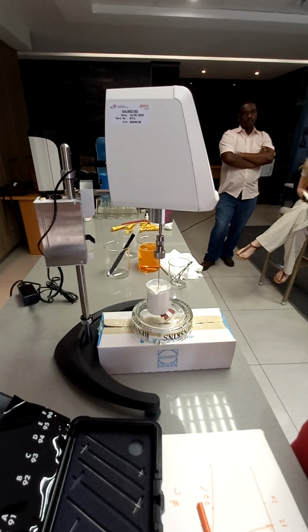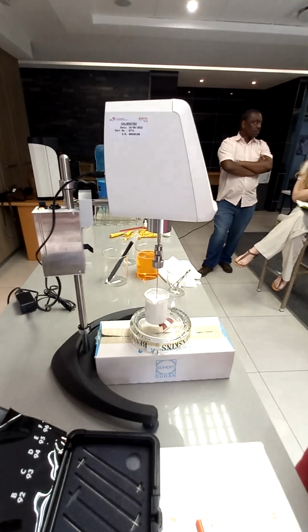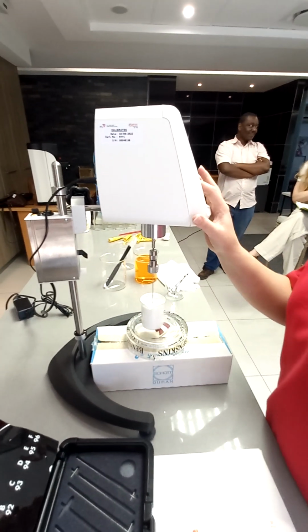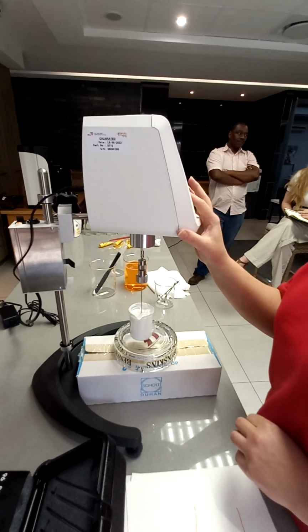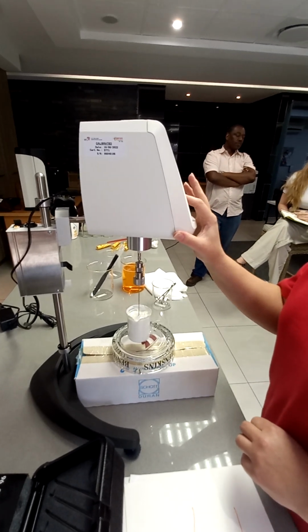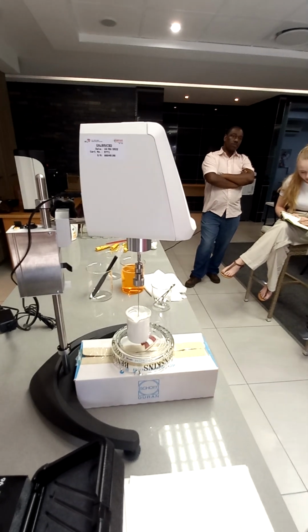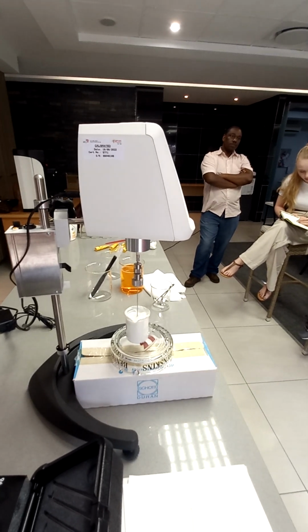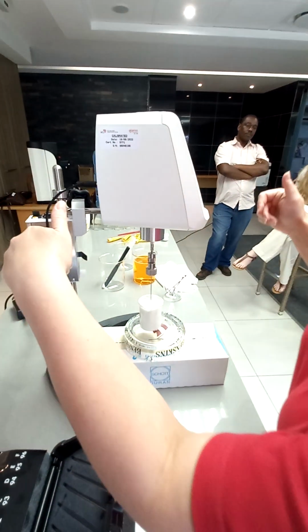Do you know more or less what spindle to use if you look at the sample? Oh, yeah, you try it, you know. I think the same as you. Maybe 92 or 93. Yeah, I've got 93. Yeah, that should be fine. I always take the middle one, then I know what side to go. Okay, then come look at the back.